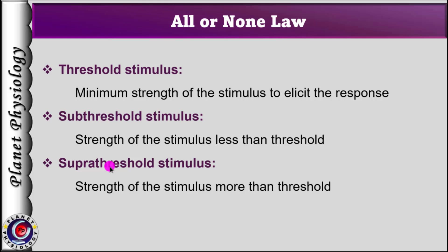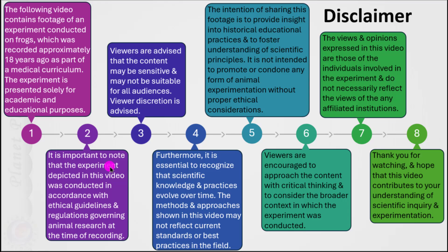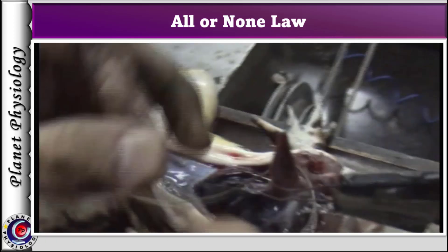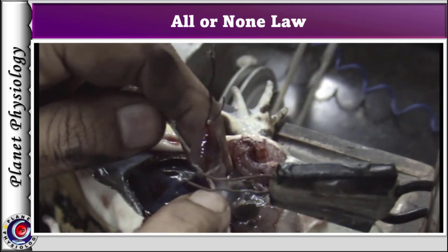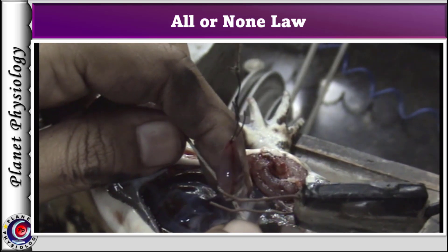With this background knowledge, let us begin with the demonstration. Please pause the video and read the disclaimer. For this demonstration, we dissect the heart as usual. The ventricle is attached to the Starling's heart lever and a mid-atrial ligature is applied. Due to application of this ligature, the ventricle stops contracting.